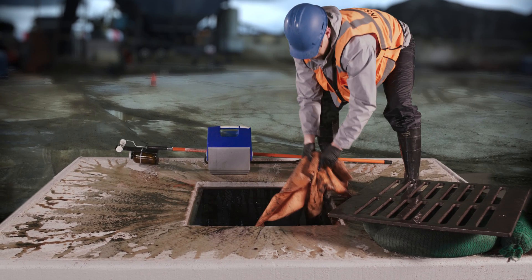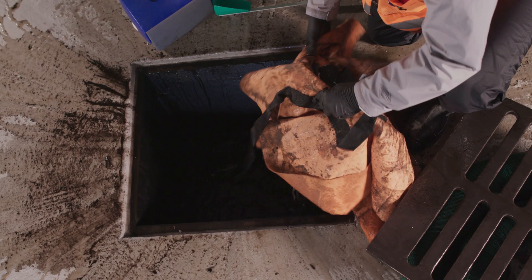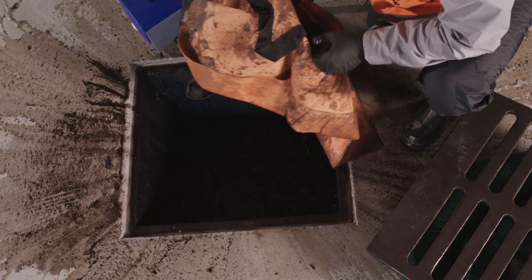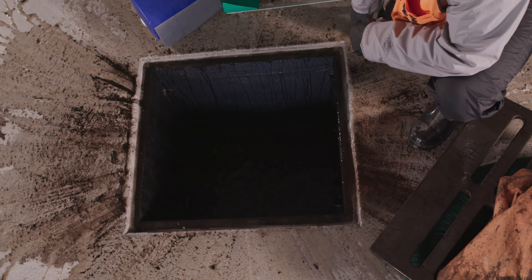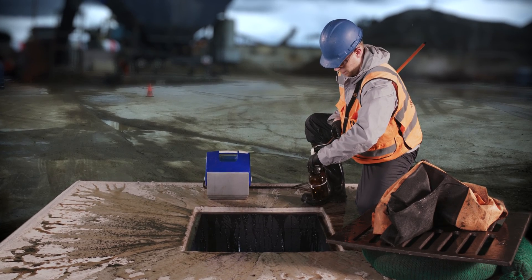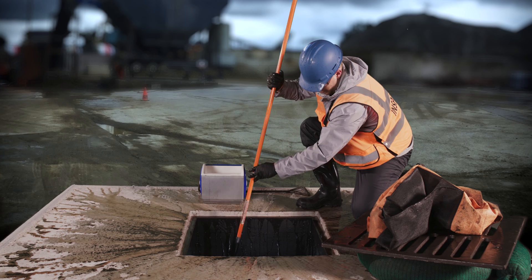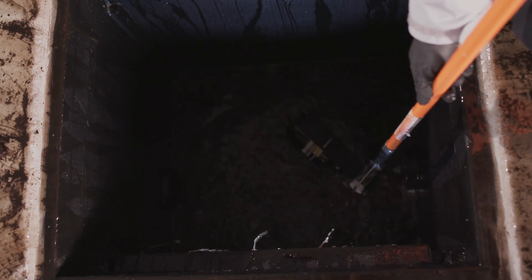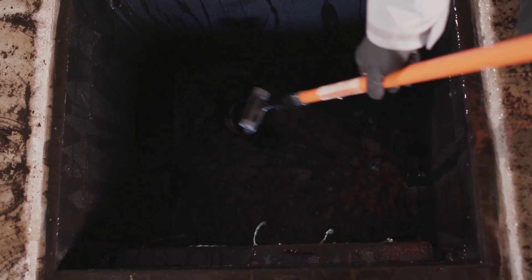The facility has a drain bag installed at their sampling point. Drain bags can be great BMPs, but having one at your sample point makes it difficult to grab a representative sample, especially when holding straps have become weathered and brittle. Remember, samples should be collected after the BMP — but here, sediment is being released right where he is collecting. The second problem is poor sampling technique: because there is not a lot of flow, he is scraping the bottom of the catch basin to fill his sample bottle. This stirs up material that may contain pollutants from years past or from non-industrial sources, and if there is any preservative in the laboratory-supplied sample bottle, it was lost while scraping the bottom.